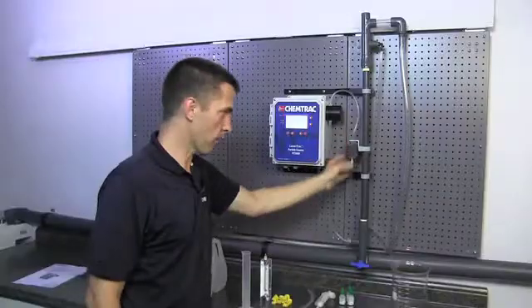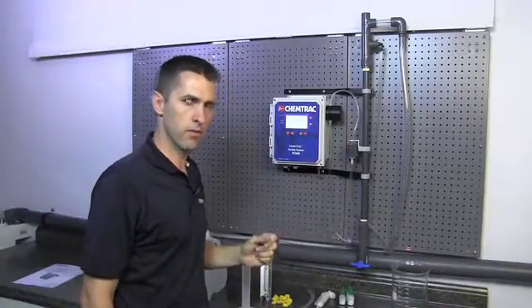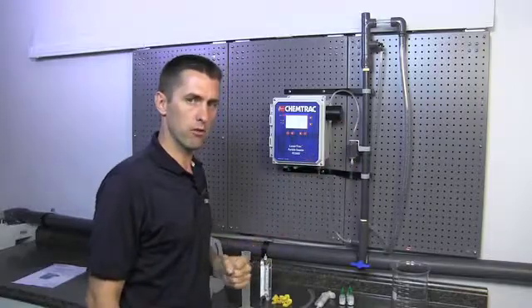As we lower or raise the drain cup, we affect the flow rate. If we lower the drain cup, the flow rate will be higher through the sensor, and if we raise the drain cup, the flow rate will be slower.